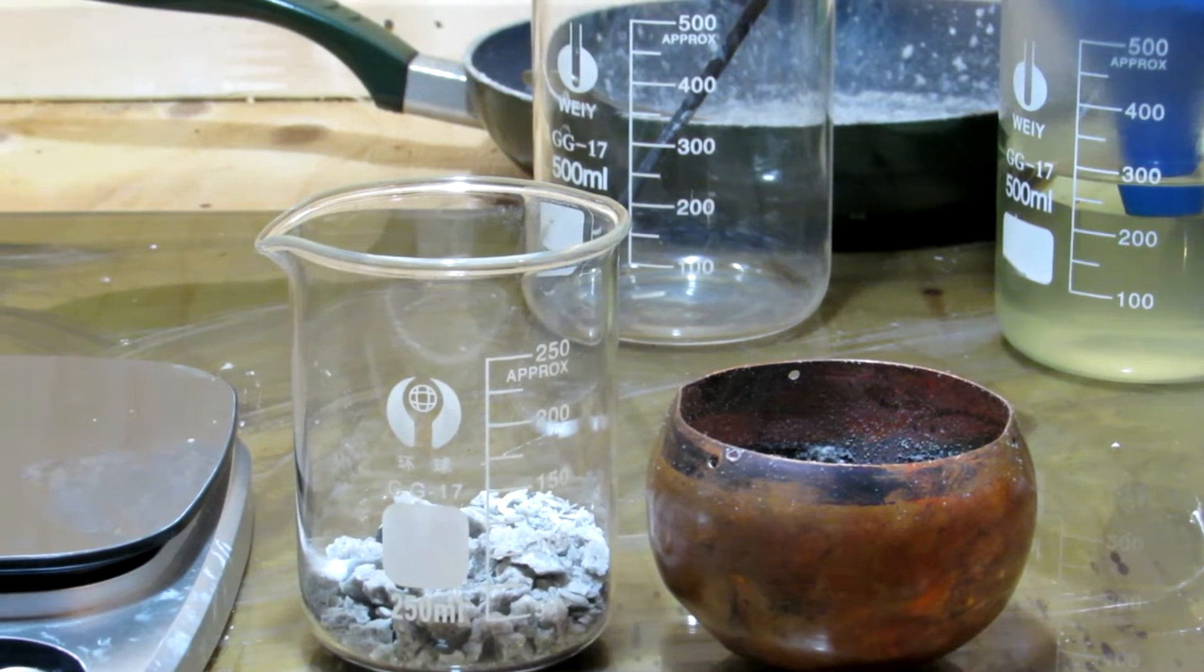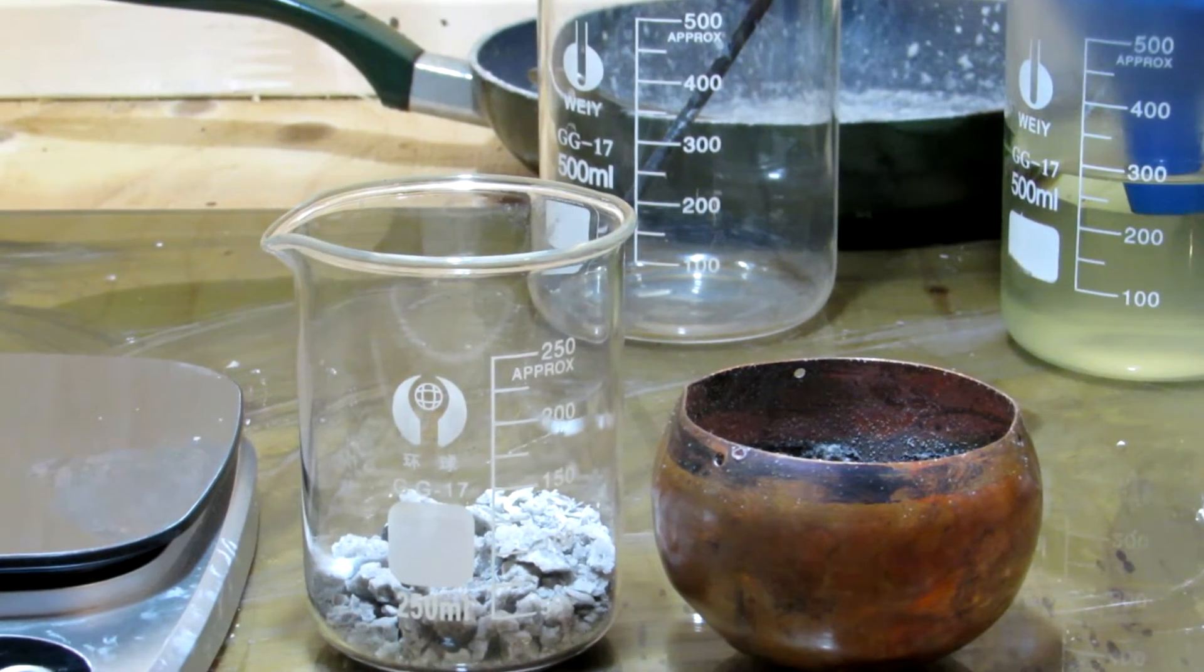Hey guys, welcome back to another video. Today we're going to be producing some sodium hexametaphosphate.